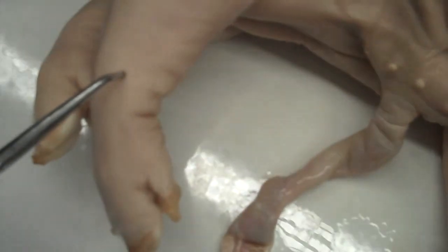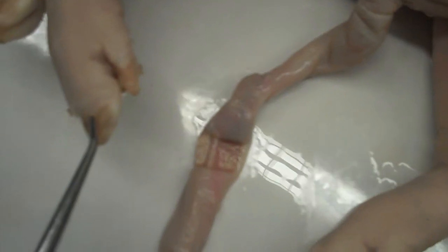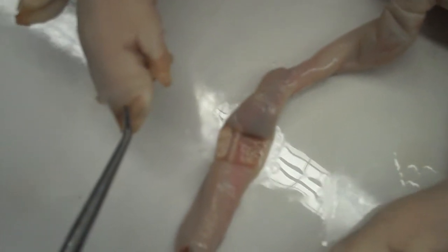And we have the elbow, the wrist, the 5th and 4th toe. Here we have the 2nd and 3rd toe.